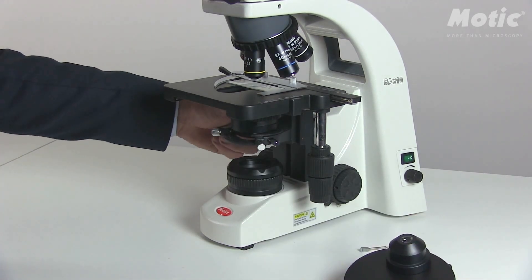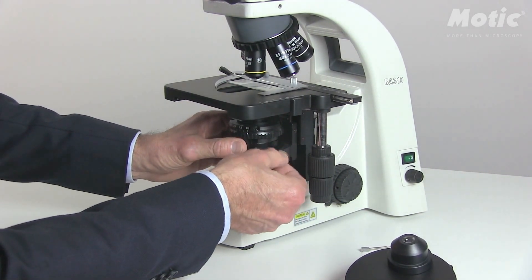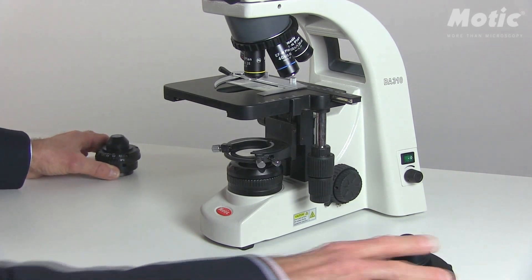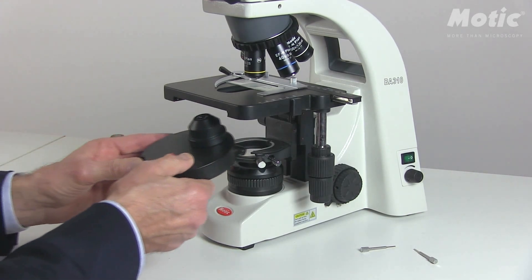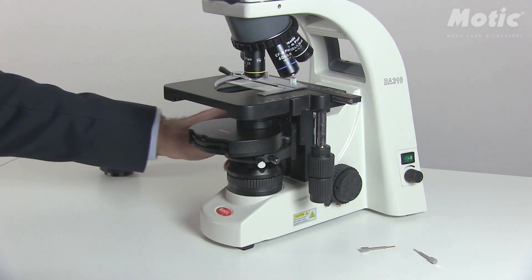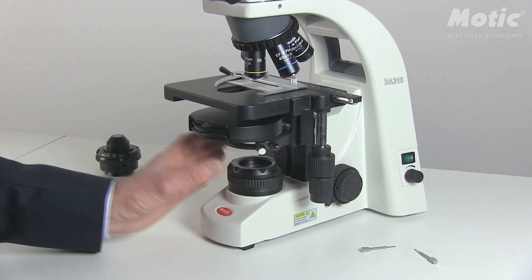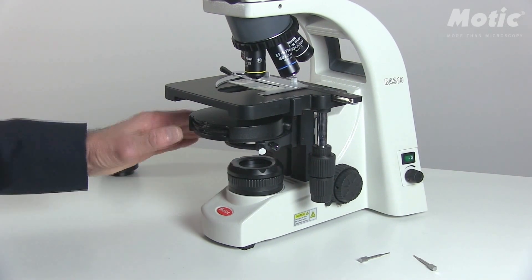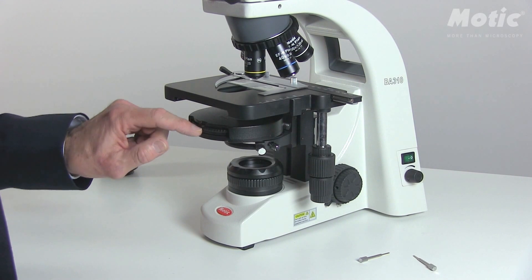Using this, first we have to remove the standard condenser — so please drive down the condenser carrier, loosen the fixing screw on the right side, and carefully take out the standard condenser. Push in the turret condenser by using the orientation pin at the back end. Fix it and drive it upwards, trying to make the perfect Köhler setup using field diaphragm and aperture diaphragm in brightfield position.